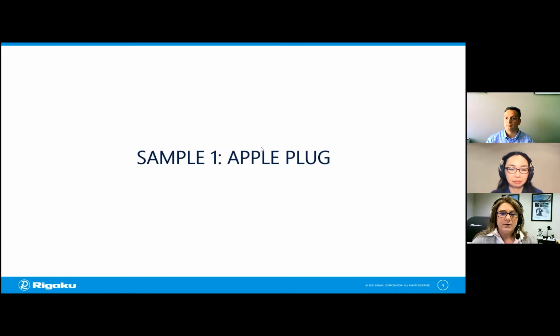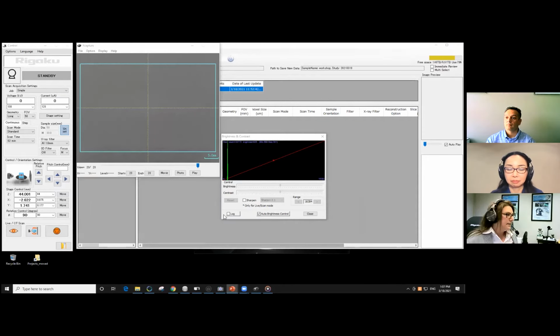So now what you should see is the instrument panels that we use to collect data. And here is the control window. From this window is where we would set the applied voltage. You chose 130. I know that things inside are fairly small, so I'm going to use a medium focus. If they were really big features, then I could crank this up. That's going to impact what our applied current will be. The smaller the focus size, the lower the current setting. And our field of view is 50 millimeters. So let's just have a quick look.